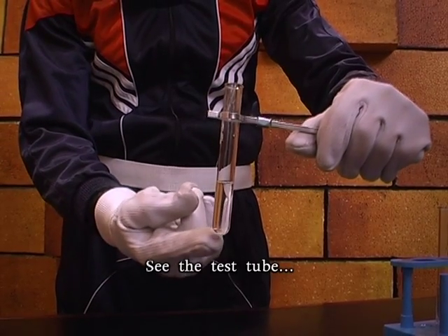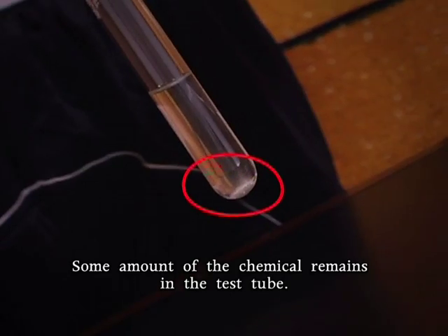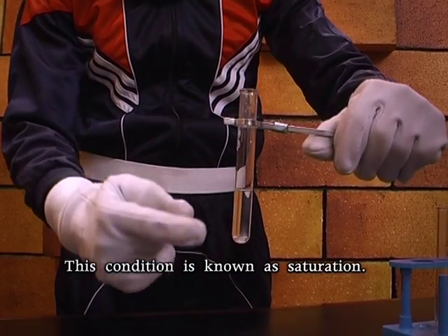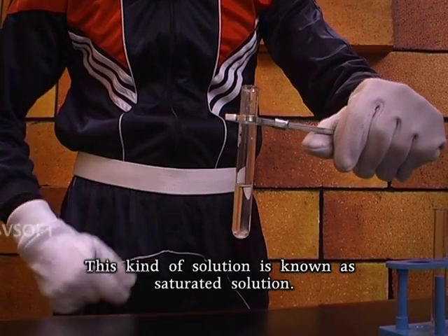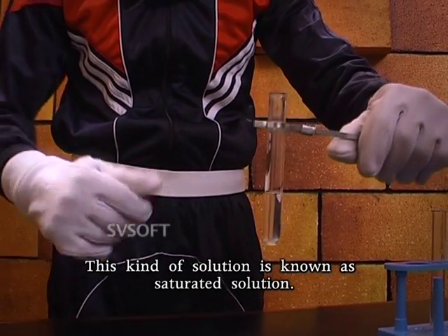Observe friends, see the test tube. Some amount of the chemical remains in the test tube. This condition is known as saturation. This kind of solution is known as saturated solution.